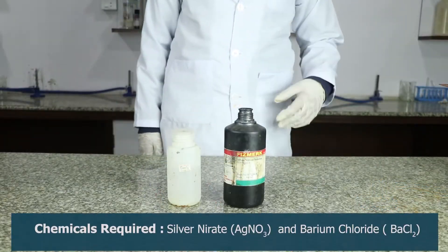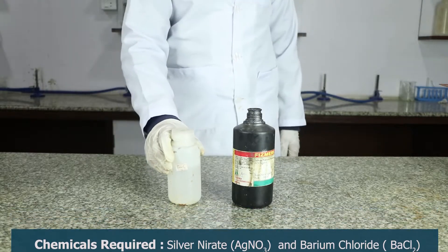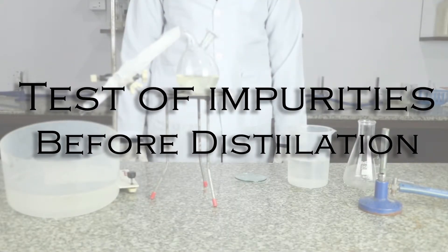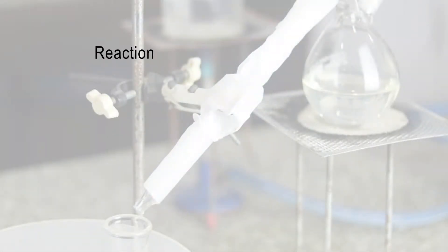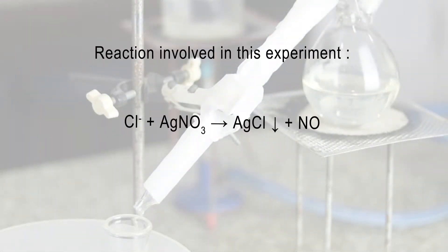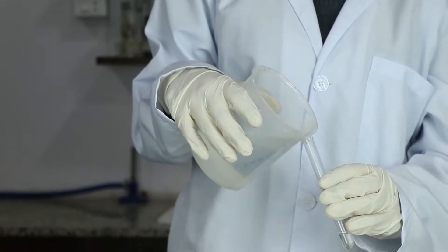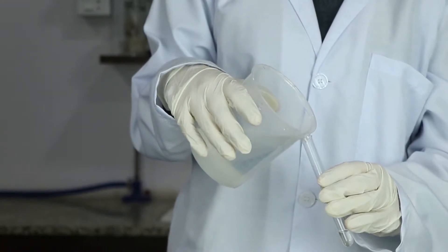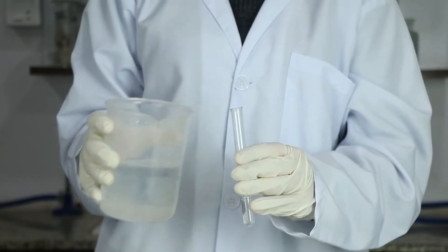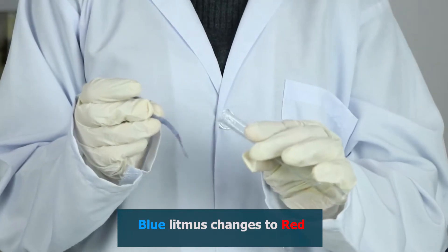The chemicals required are silver nitrate and barium chloride. Test of impurities before distillation: take a few ml of sample solution in a test tube and test the sample with litmus paper. Here, blue litmus changes to red.